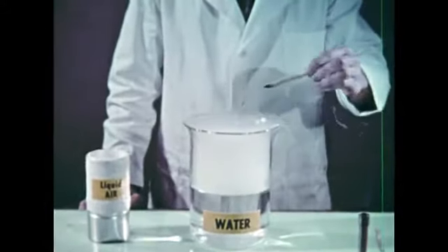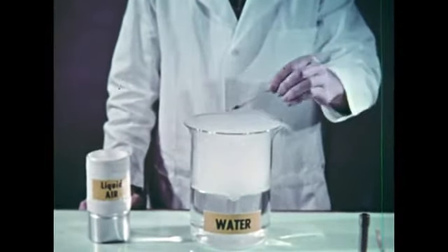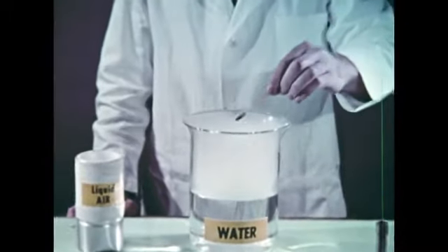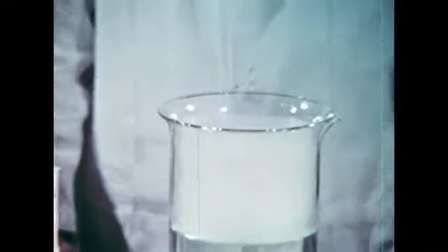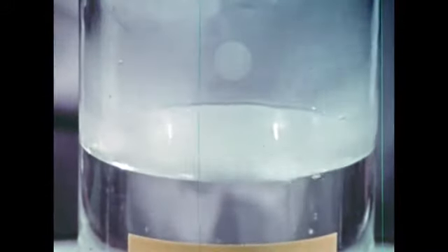But when we try it again, we see that we're now getting oxygen gas. This is the chief industrial method because it uses the least energy and the cheapest material, namely air. Oxygen is usually made on the spot because storing it's a problem, although it does come in gas tanks for labs and is shipped at low temperature in liquid form called LOX for industry.